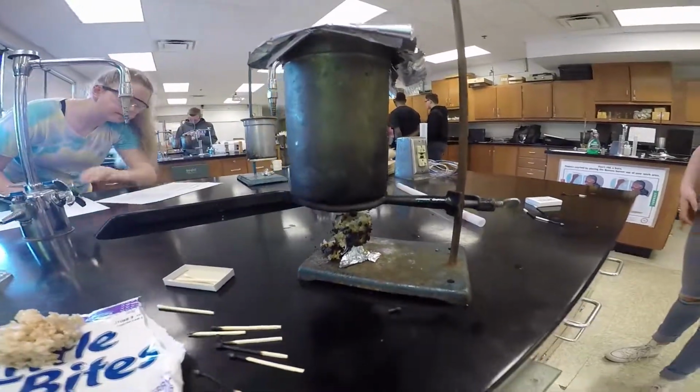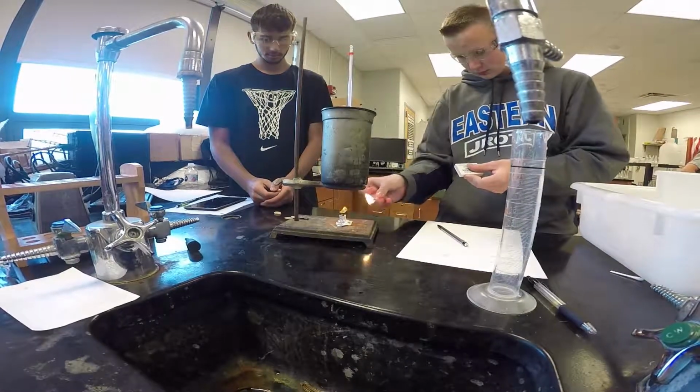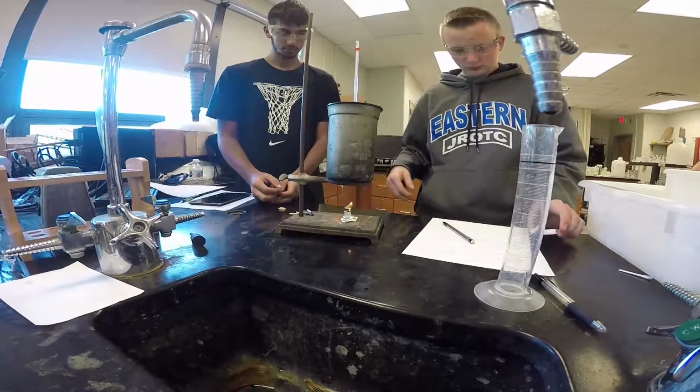So now what I would do is... I don't remember from last year which one works better. I think the ice one works better, but I don't know.